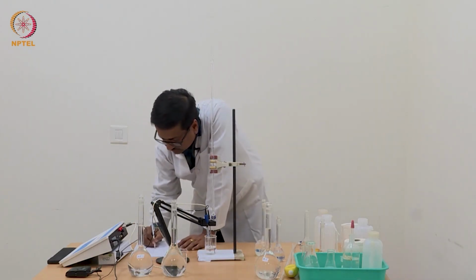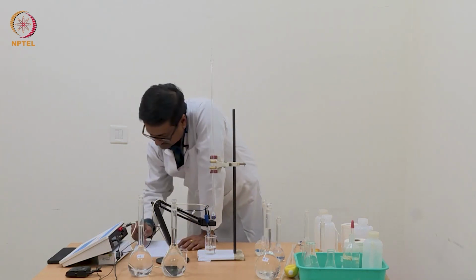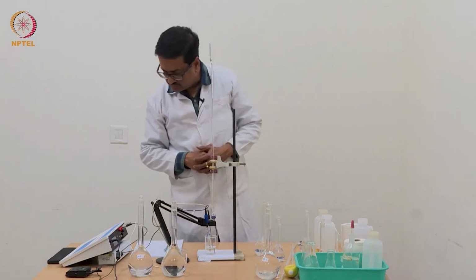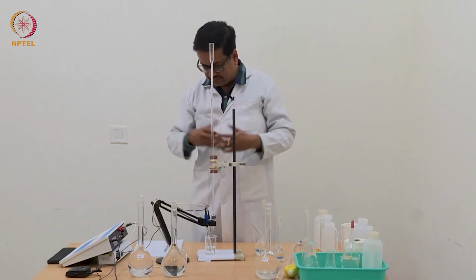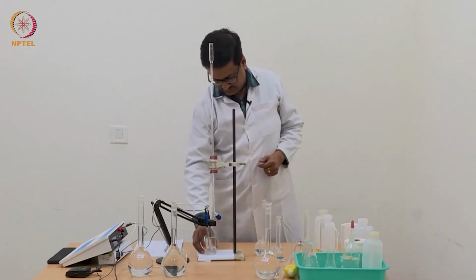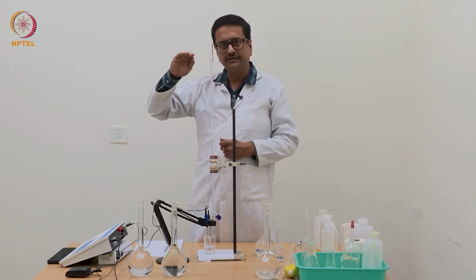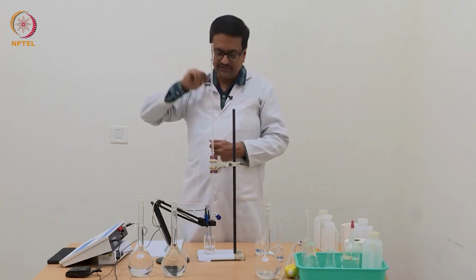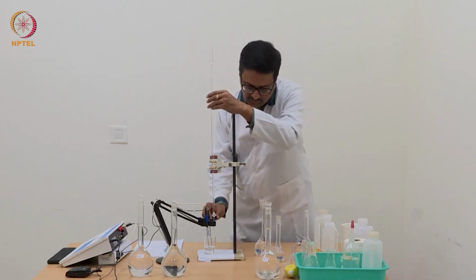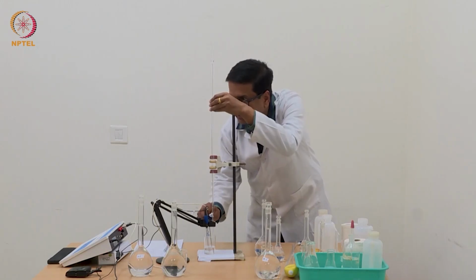Now we have reached 1.60 ml and pH has just crossed 10. So I think we can do 2 or 3 more readings and then stop this experiment, because now we have reached a situation where towards the top the pH is now slowly stabilizing at about 10. So with these data points we will be able to draw a nice S-type curve.